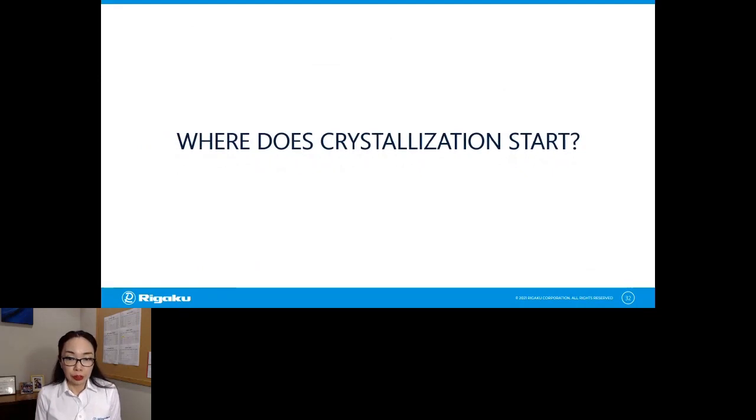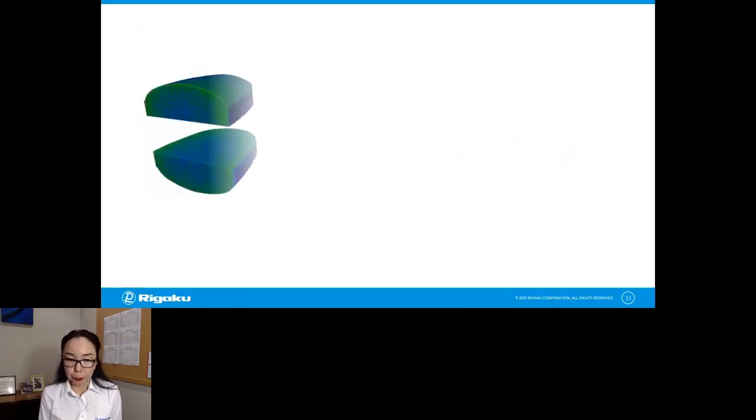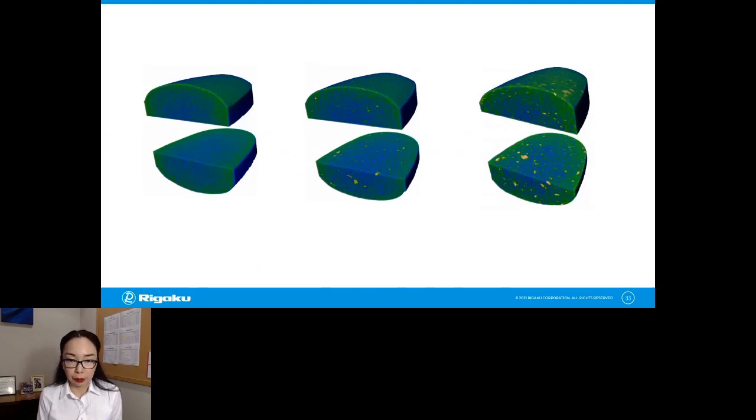The next example I want to show you is about crystallization. So when you're trying to use amorphous API, you don't want to see or have any crystalline materials inside of your tablet. But if they are there, it might help to see where they are and how much of it you have. So in this example, we scanned 3 different tablets with a different amount of crystalline materials. Those yellow speckles you see in the middle, you see more of them in this tablet. Those are coming from the crystalline API. And you can see them this way because there was density difference about 8% between the crystalline API and the amorphous API with a polymer mix. So that is enough density difference for us to see the crystallites.